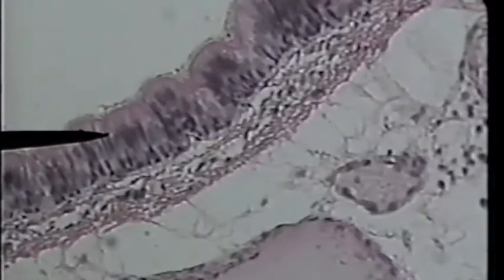At first glance, it appears that there are multiple layers of cells in this epithelial layer. However, each of these cells is actually in contact with the basement lamina, so it really is only one layer of cells. This is called pseudo-stratified epithelium, or falsely stratified.